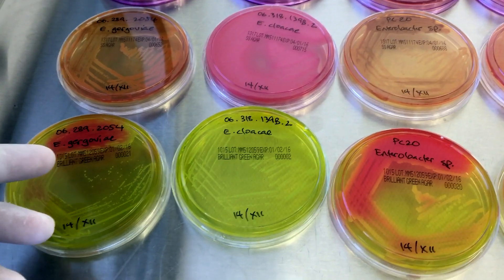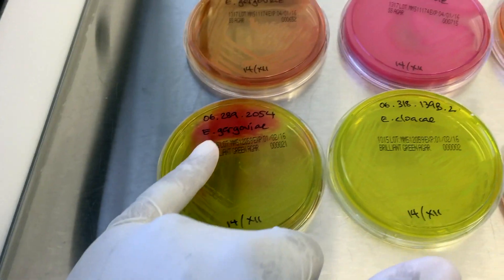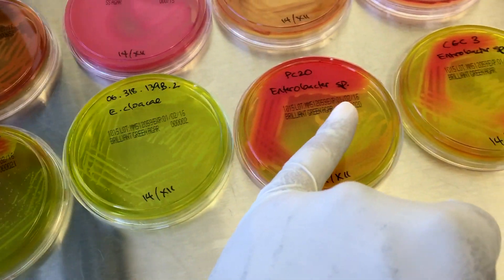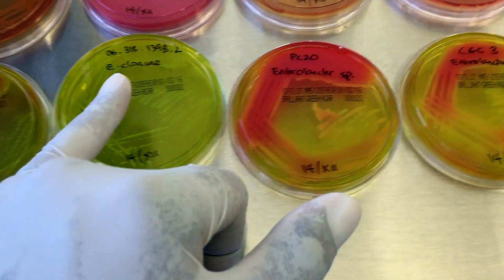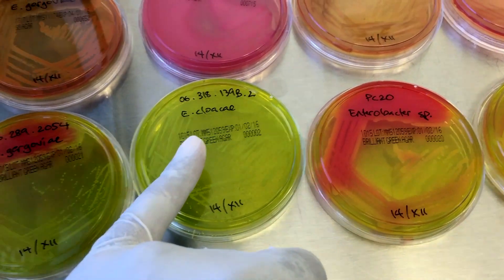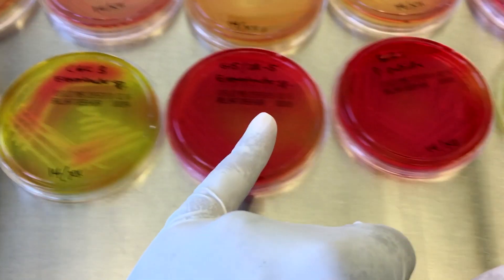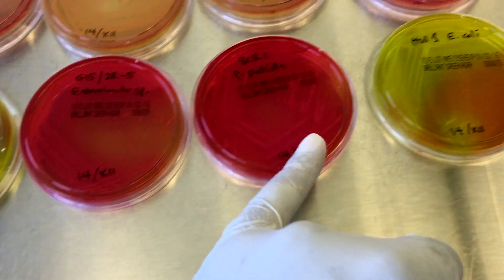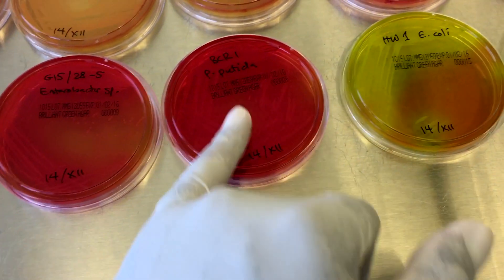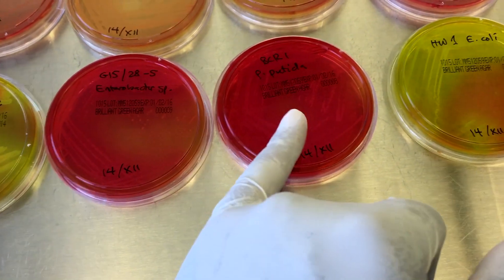Like the other bacterial media that can help me in distinguishing what type of bacteria they are. As you can see, individually, this red-pinkish coloration is very distinct for the Enterobacteriaceae species, except for Enterobacter cloacae. However, Pseudomonas also has that same very pink coloration. This happens when the bacteria are feeding on the nutrients in the Agar.